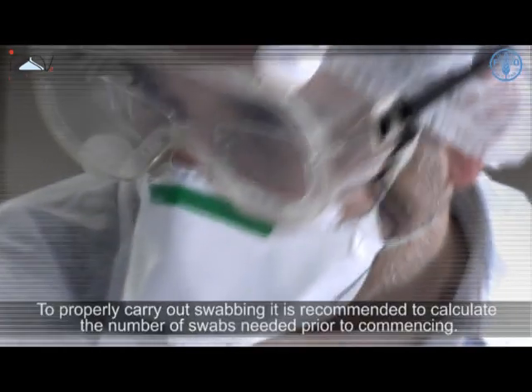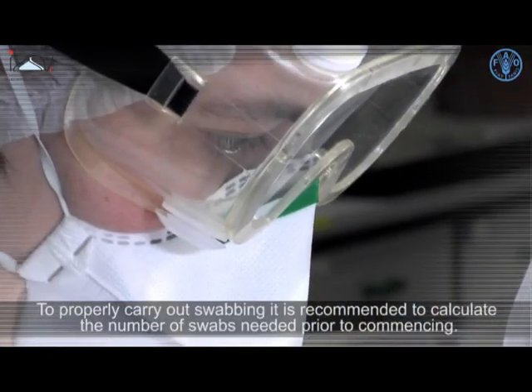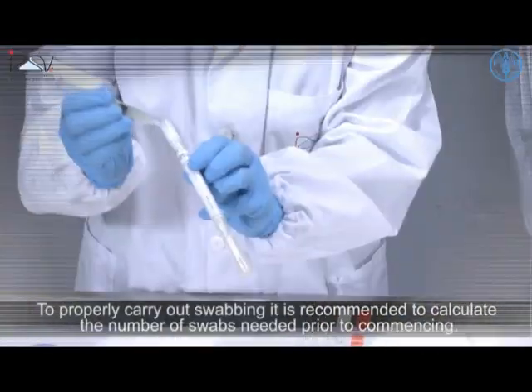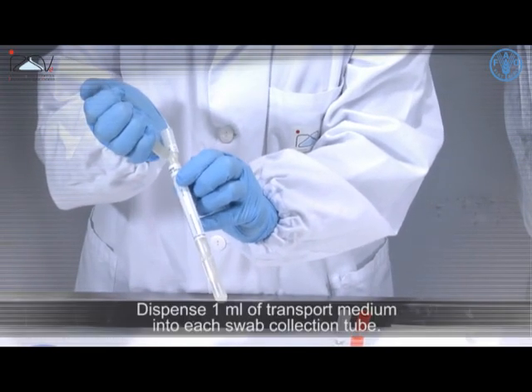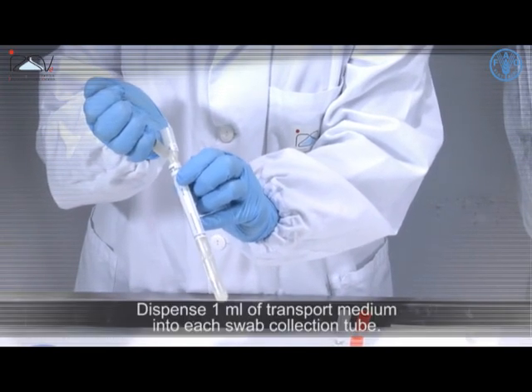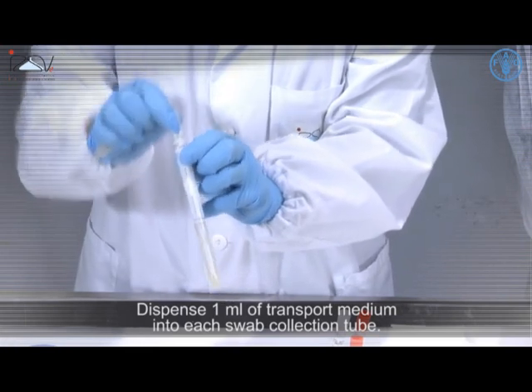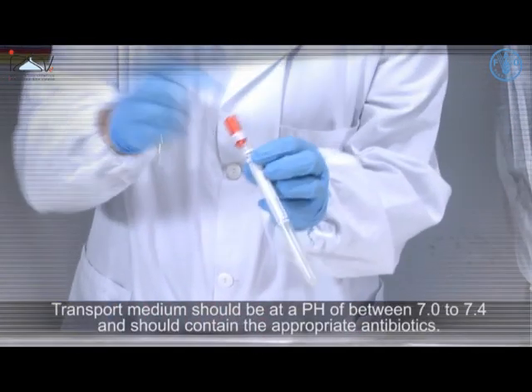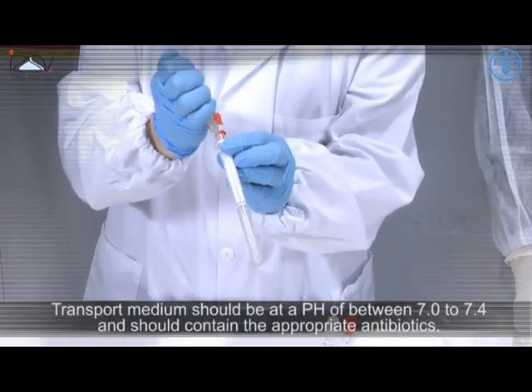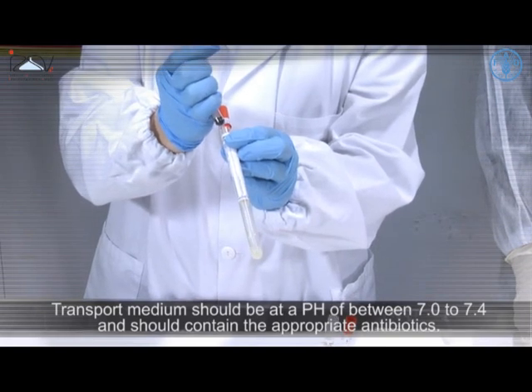To properly carry out swabbing, it is recommended to calculate the number of swabs needed prior to commencing. Dispense 1 ml of transport medium into each swab collection tube. Transport medium should be at a pH of between 7 to 7.4 and should contain the appropriate antibiotics.